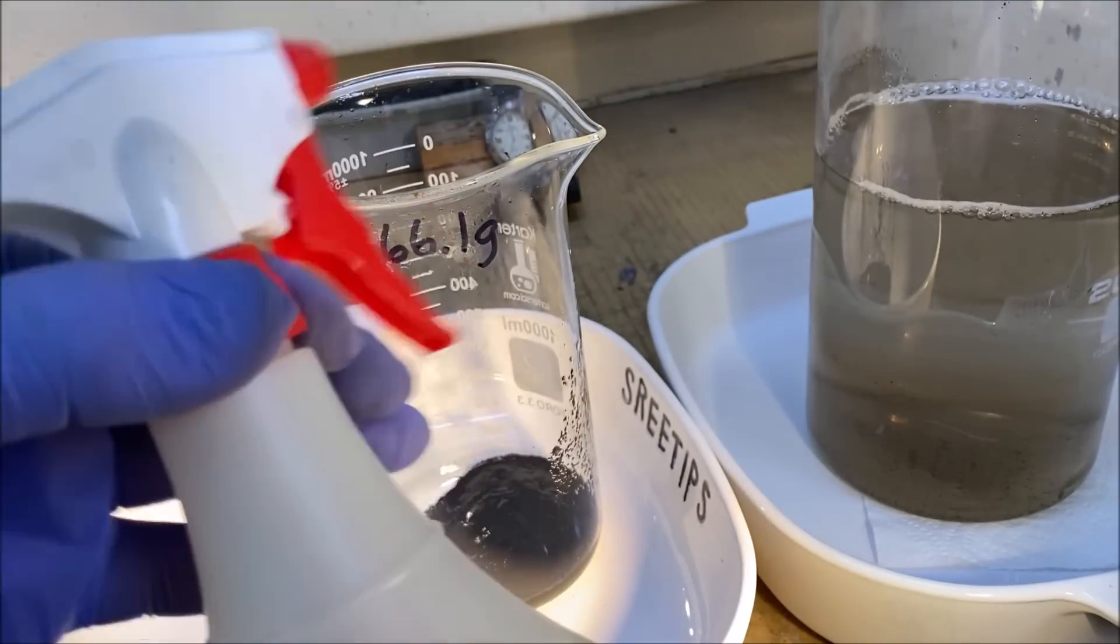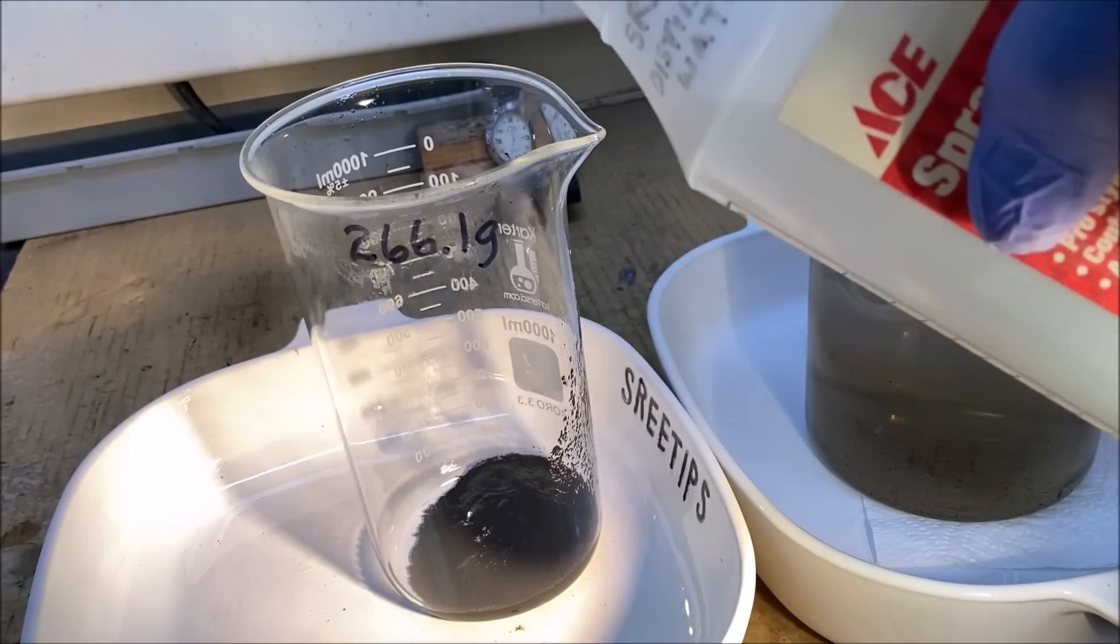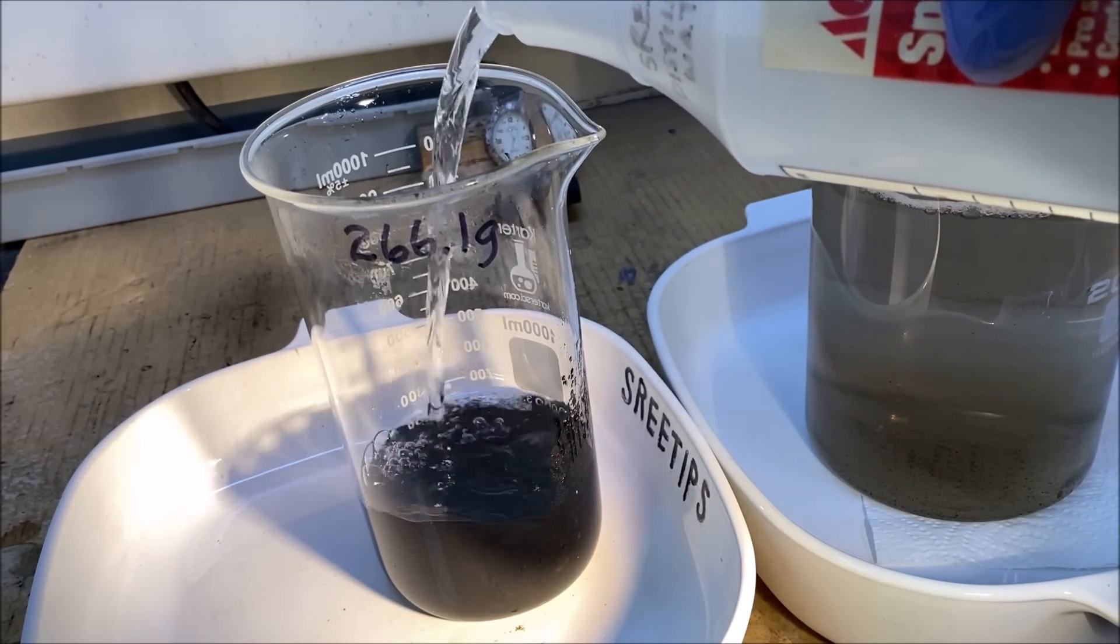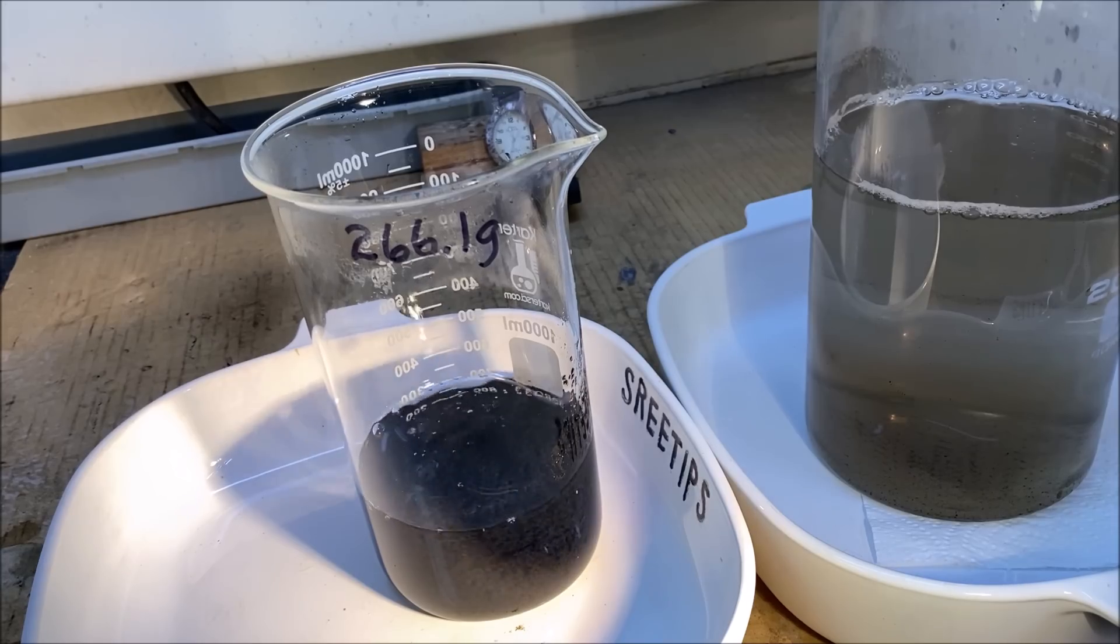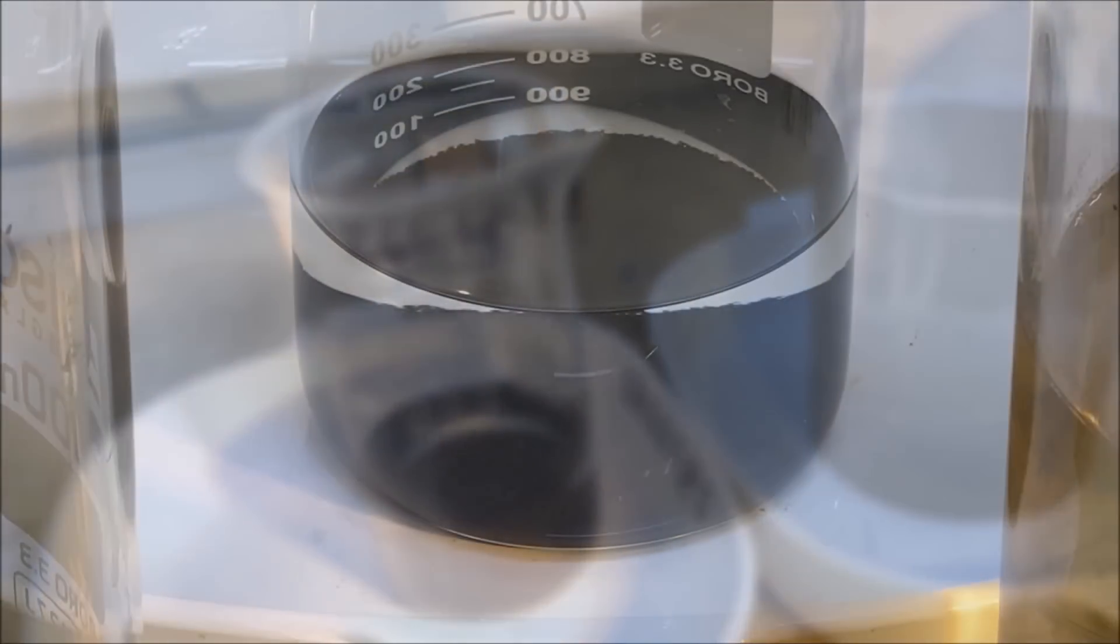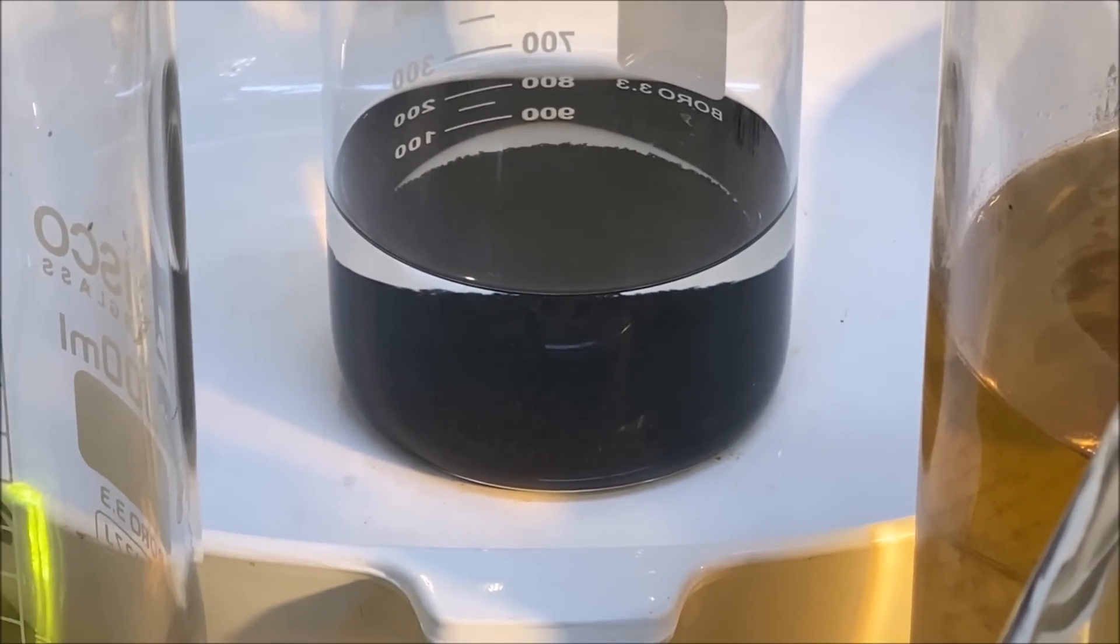I think what we're going to do now is just cover this up with some distilled water. And then figure out what we're going to do for the next step. Here's our mixed black PGM powders in distilled water.